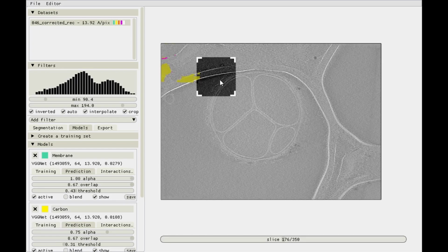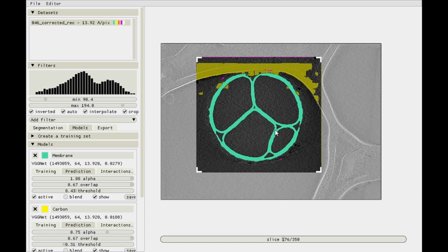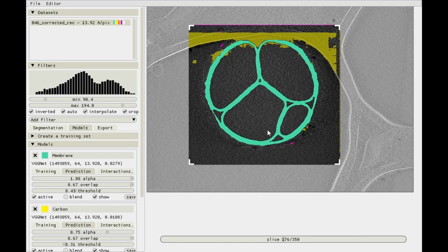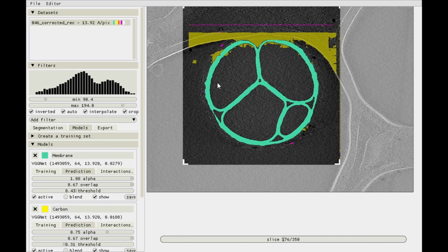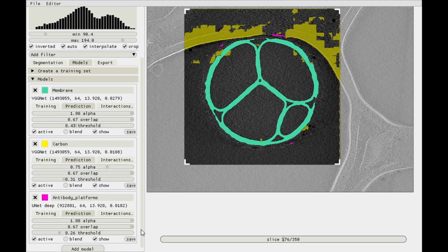But by just moving the region of interest over here, fine, right? Sorted. So let's use that. And then what's more? We still get some bits here and there. So there's a pink artifact over here, which again is due to the overlap and can usually be ignored. But there's also a prediction over there. Maybe gone if we increase the region of interest, and a prediction over here, right? So that's not what we want.